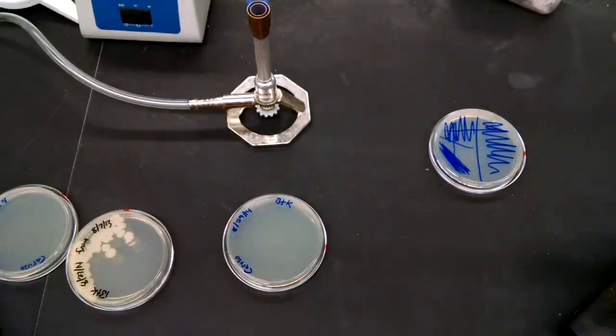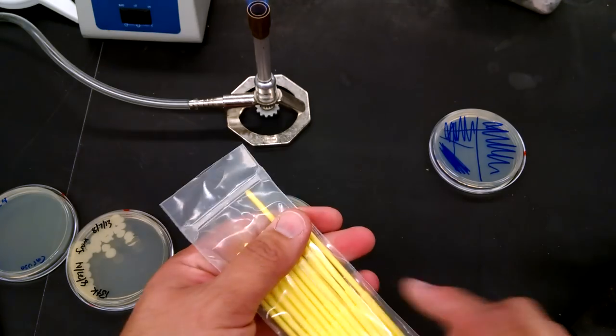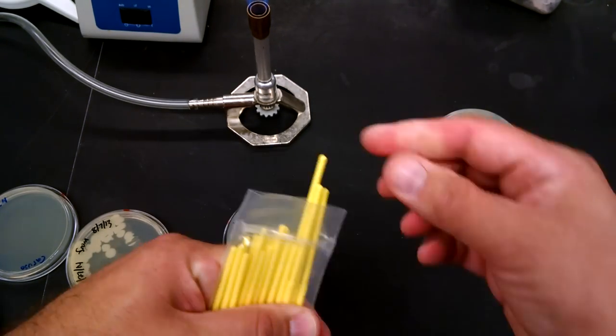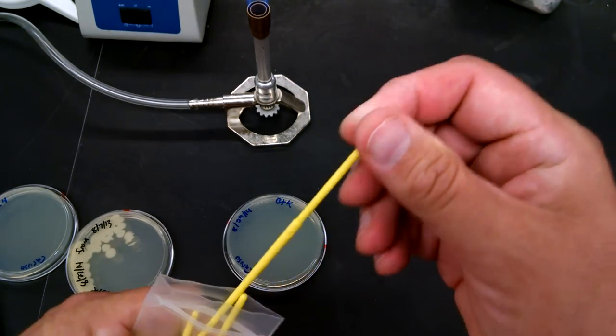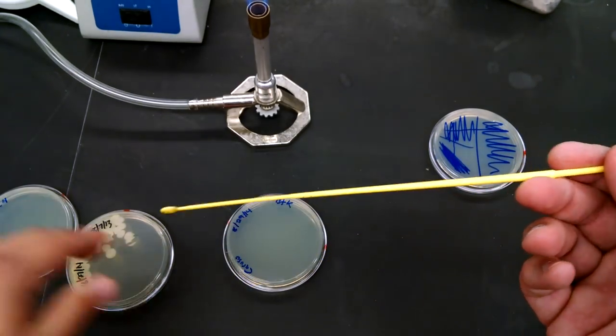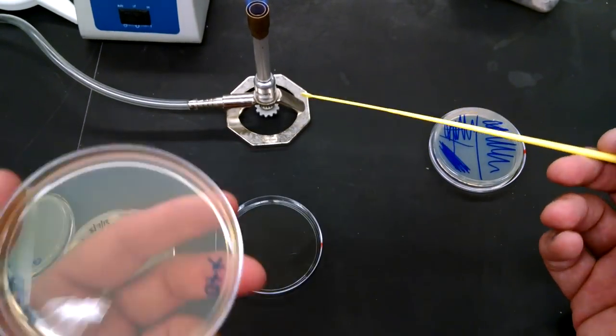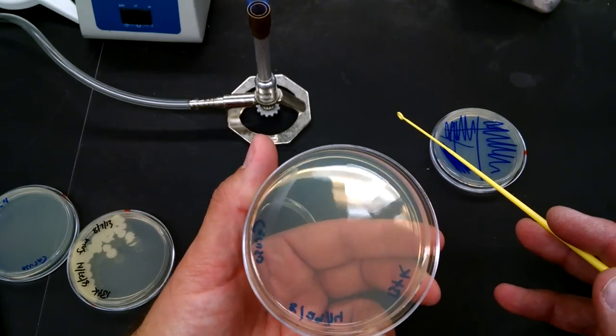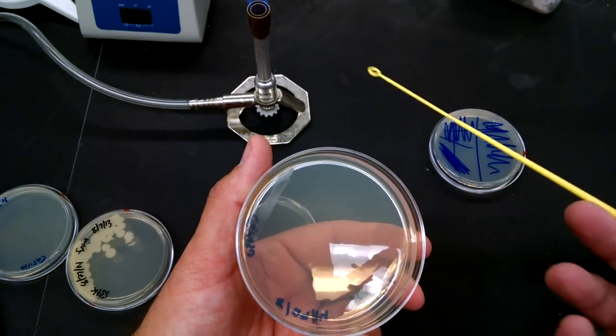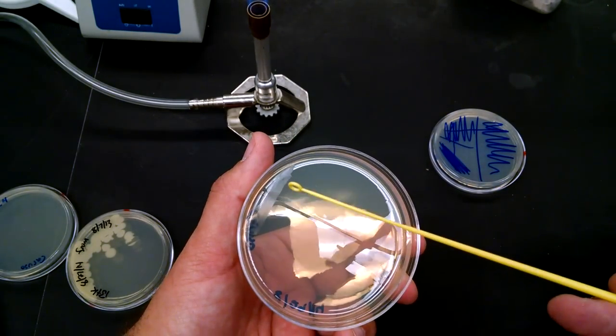So I'm going to throw it away into a waste bin. Now I'm going to get a new loop, touching just that one. All the rest of them go back uncontaminated. Now if you move this in the light, you can see where you drew, right? Right there.